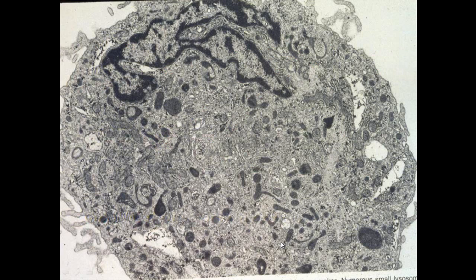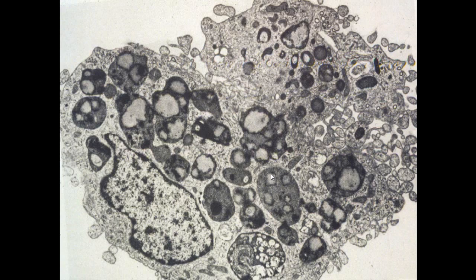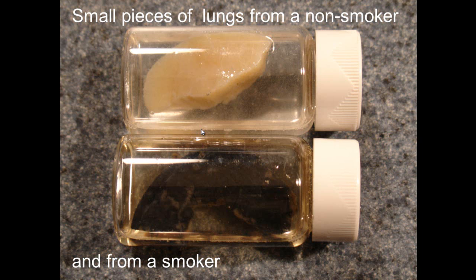Here we see a macrophage with the organelles. They've got Golgi apparatus, machinery, lysosomes, mitochondria, ready to gobble up anything that's exposed to it. And this is from a smoker. A smoker already has its cells filled with debris from the tobacco smoke, and so they're less resistant than a non-smoker would be if exposed to environmental conditions.